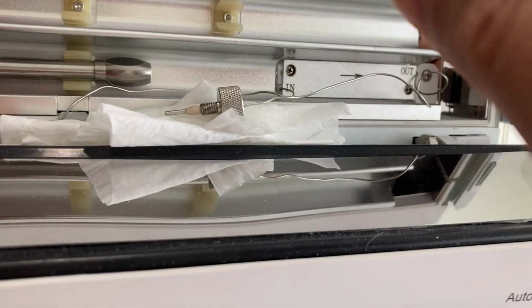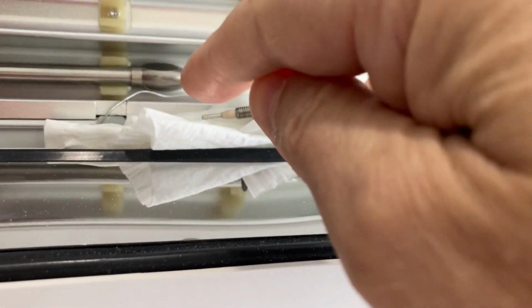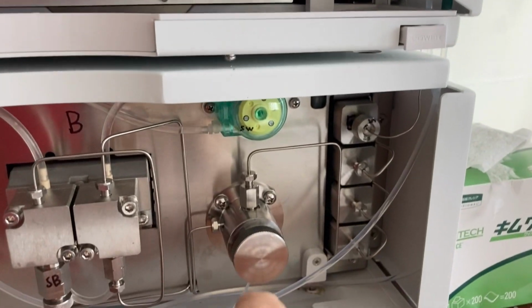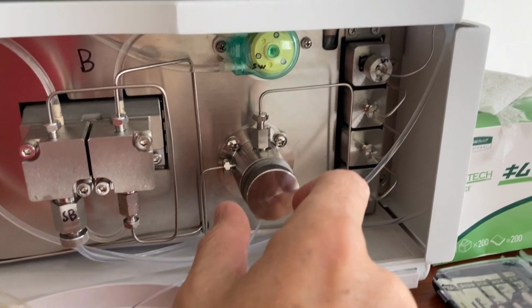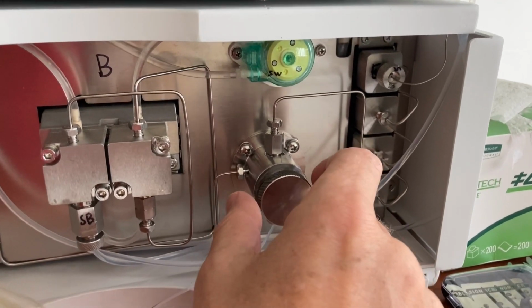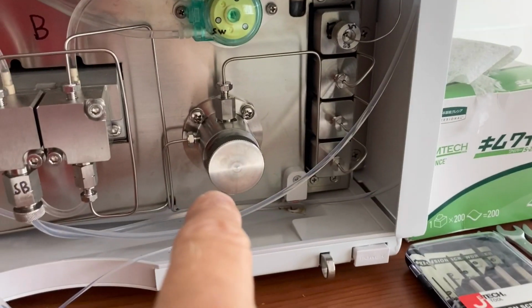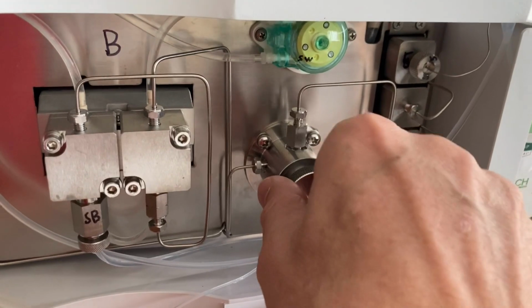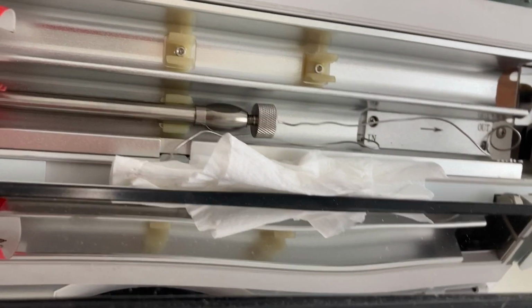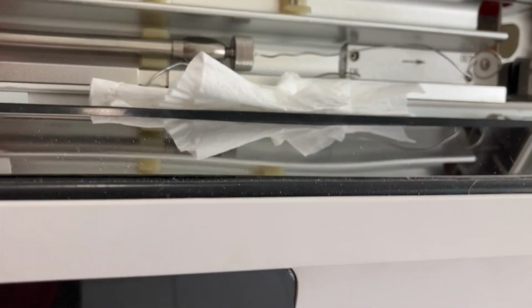And then I'm going to connect the line up to the column first and then turn off the bypass vent valve in that order. So this first, connect, then turn that tap off. Now once the vent valve is turned off, the pressure is going to start building in the system. This is where we get to see if there's a leak.